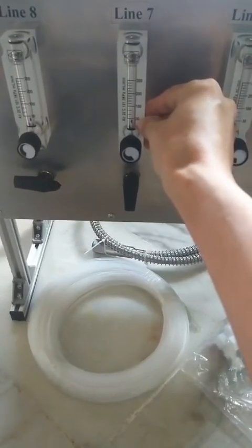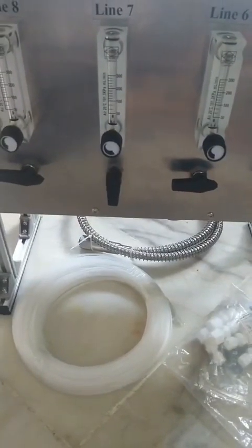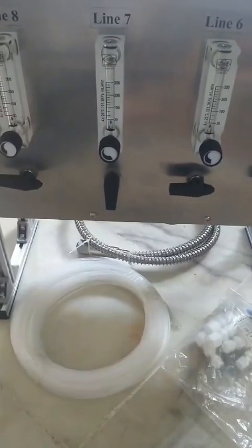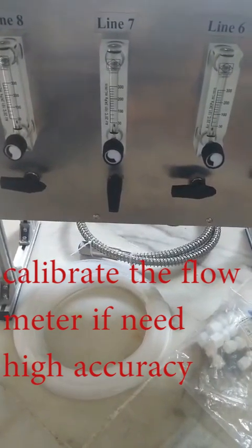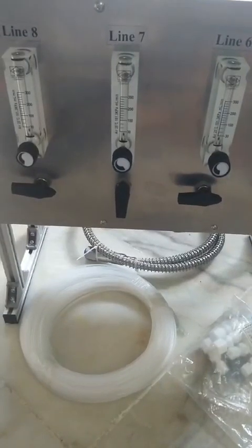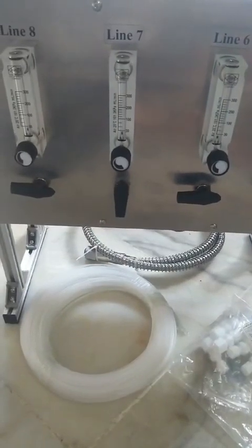But if your gas has a different density from air, and you also need high accuracy, you can do the calibration with a soap bubble flow meter to get the real factor for your flow meter. Normally, if you use the calibration based on air, it is enough for your common application.